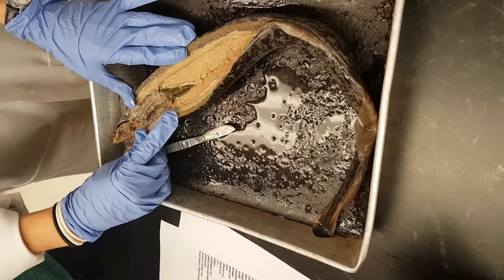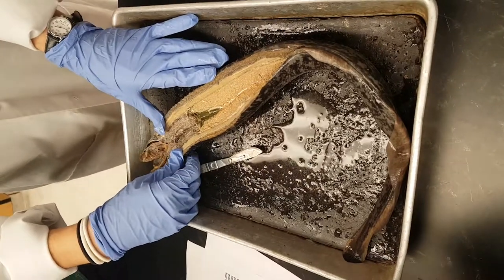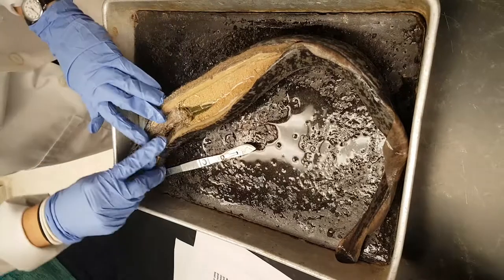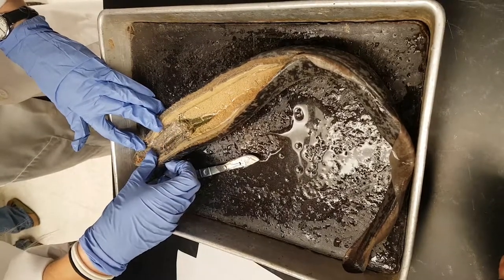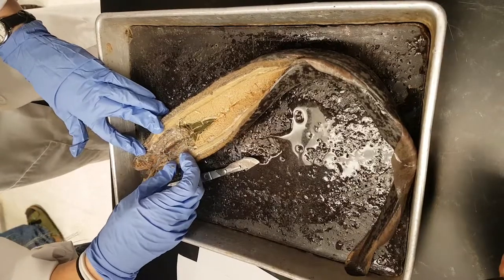You can video all you want, but you just can't charge money for it. The pharynx will be this part right here. It's a little hard to see when you cut through like this, but it's basically the entrance right from the mouth. This line here basically just runs right through from your mouth down to your digestive system.